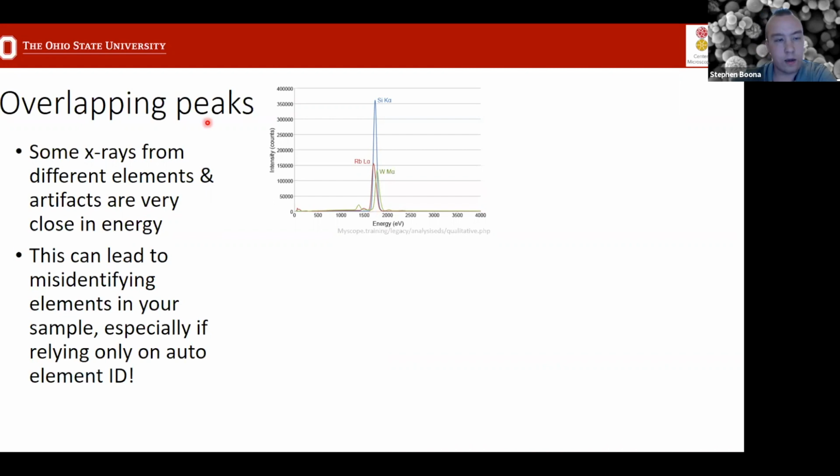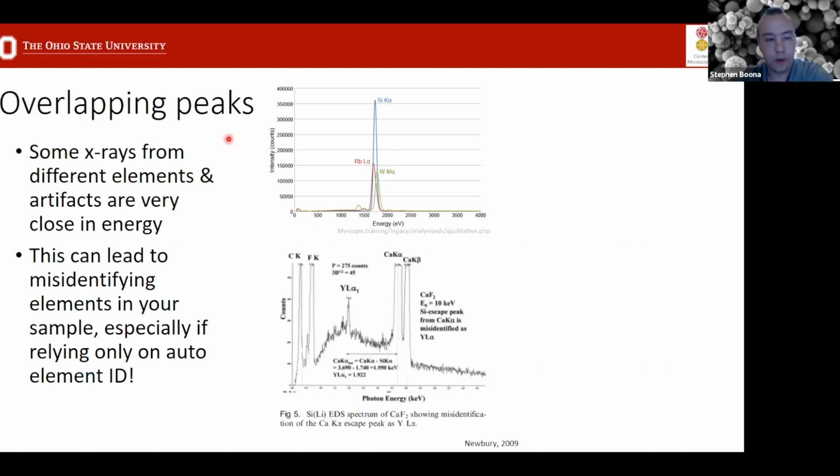So if you rely on automated peak ID, especially if the software is only looking for 1 peak per element, then this can be an issue that pops up. And as an example, again, calling on Dale Newbury here, in this case, this is a calcium fluoride sample, very well defined. There are only 2 elements plus some carbon on the surface, yet the EDS software tells him that there's yttrium present because there's a calcium escape peak that corresponds exactly with the location of this yttrium L edge. So he knows better that there isn't actually yttrium in the sample, but if he didn't think about it and just trusted the results, then he would have included this.